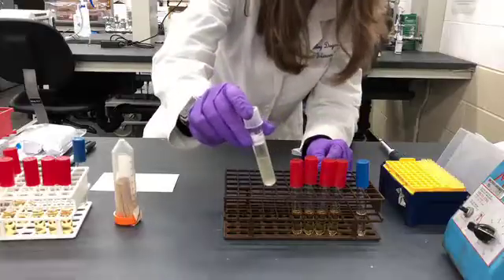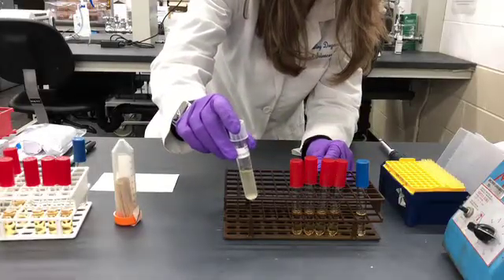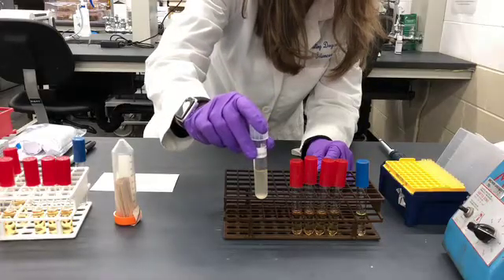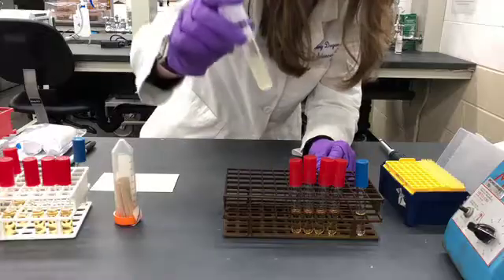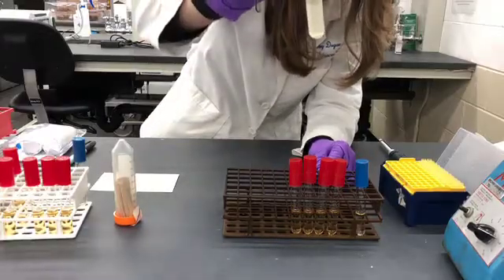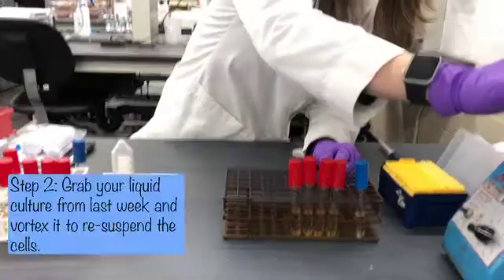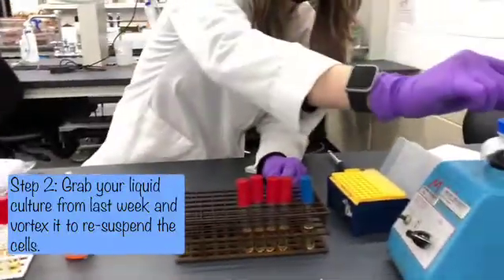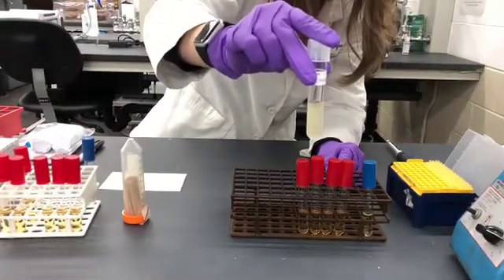You remember last week you made a liquid culture of your bacterial unknown. We incubated that for two days at 37 degrees and then put it at 4 degrees. Now since it's been sitting for a while, some of the bacterial cells have collected at the bottom. We're going to use a vortexer to gently put some of the cells into suspension.